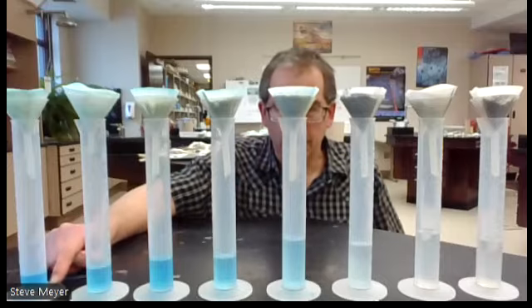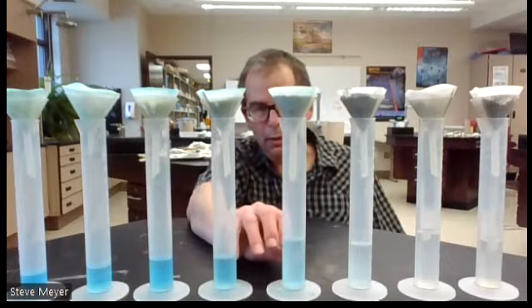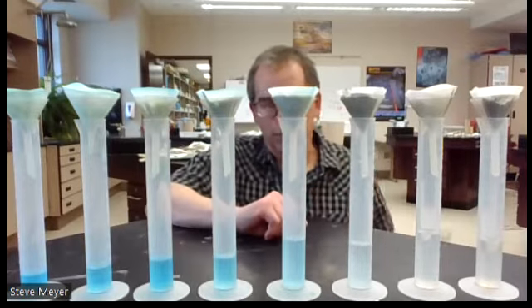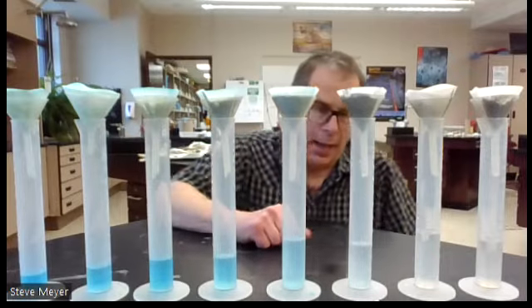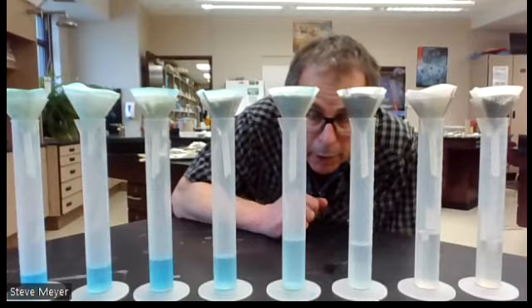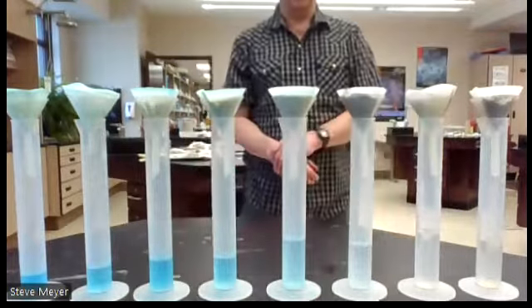Test tube 8, I don't know if you can tell, but it's a pretty dark blue color. And you can kind of see that progression, and maybe more lighter blue in the middle here. So we got clear, got darker blue over here and lighter blue here. And this would just be some sample data of the filtrate, the things that drip through. Again, that contains not only the spectator ions that drip through in the product, but also any excess reactant, plus the water that you filtered with as well.